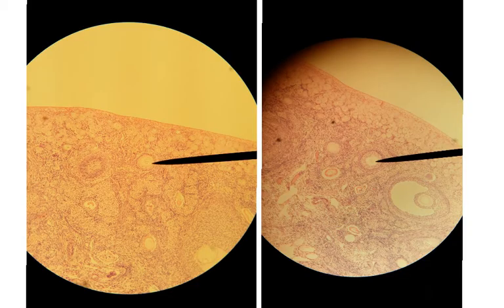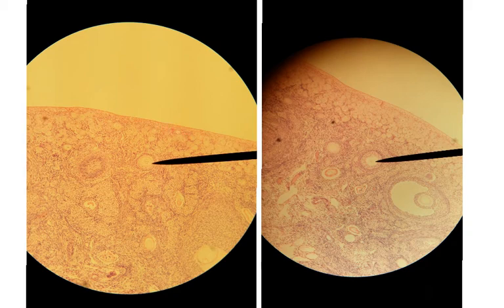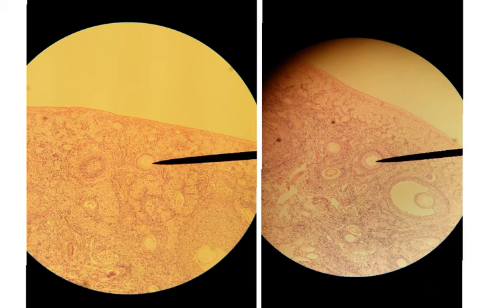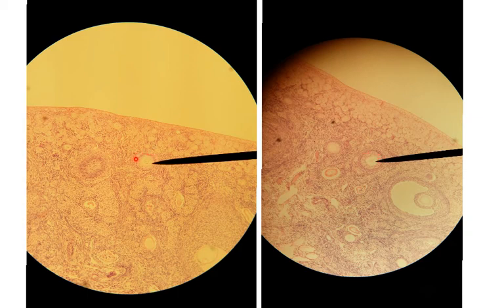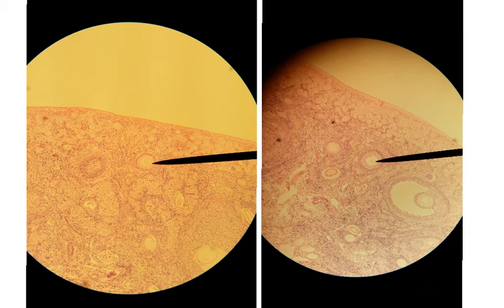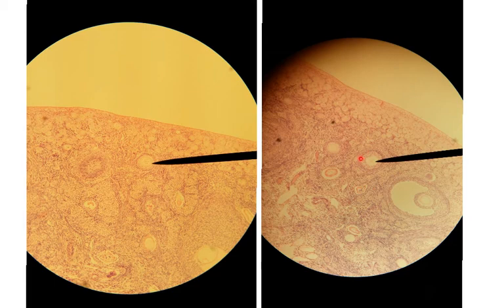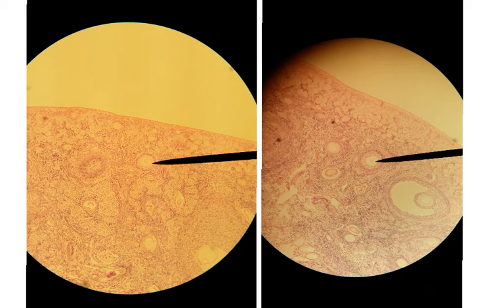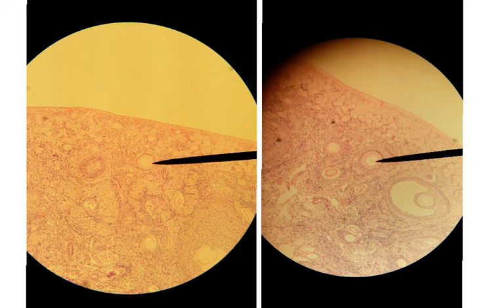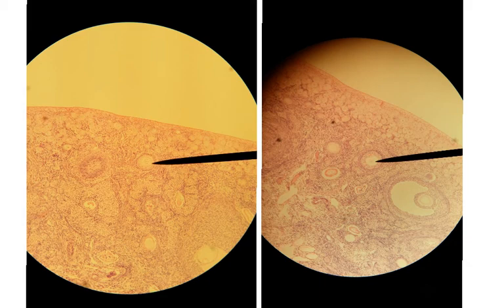Now let's look at some that are starting to develop — primary follicles. We can still see primordial follicles clustered around the edge, but primary follicles come in two versions here. On the left we have a single layer of cuboidal epithelium around the developing egg, or oocyte. On the right slide, this is still a primary follicle, but now we've got a few layers of cuboidal epithelium surrounding that oocyte. In both the left and the right, we see no open antrum within these cuboidal epithelium layers.